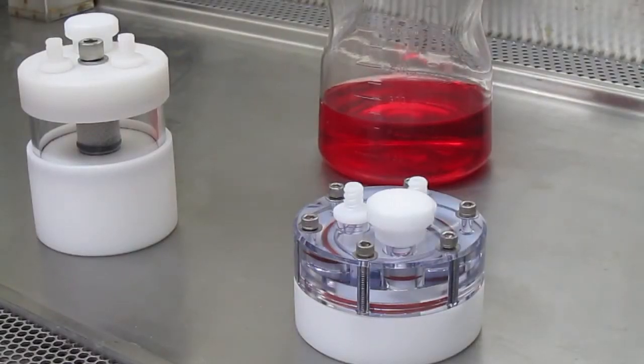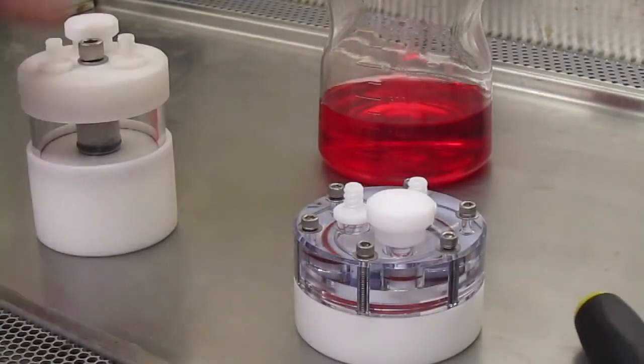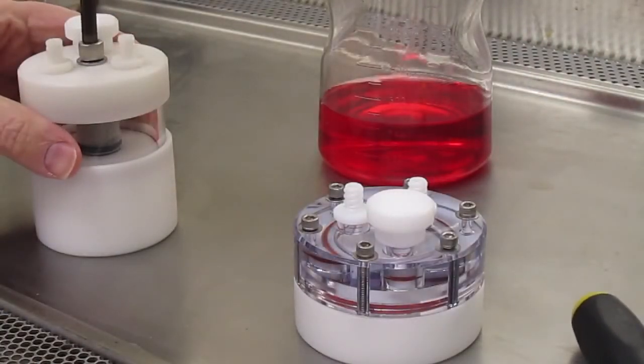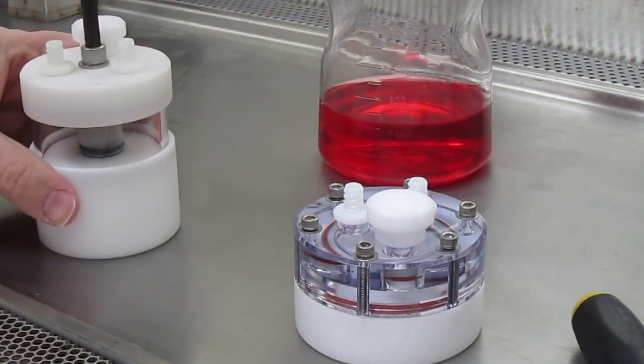After autoclaving, the vessels are taken to a hood and the bolts are tightened. It's not necessary to over-tighten the bolts.